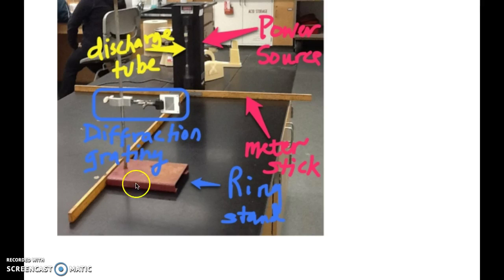On the bottom part of the T, you're going to put a stand. And then on the stand, you're going to have a clamp that's going to clamp on a diffraction grating. This diffraction grating acts like your prism. And if you look through the diffraction grating, either on this side or on this side, you'll see that this light shines, and so the light hits the diffraction grating, and then it gets split, you're going to see that on this side it will show lines that compose that particular element. So that's the way this thing should be set up.